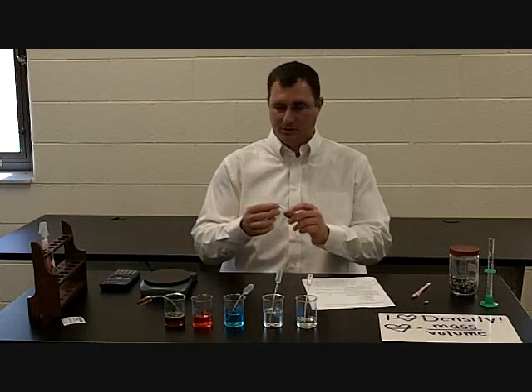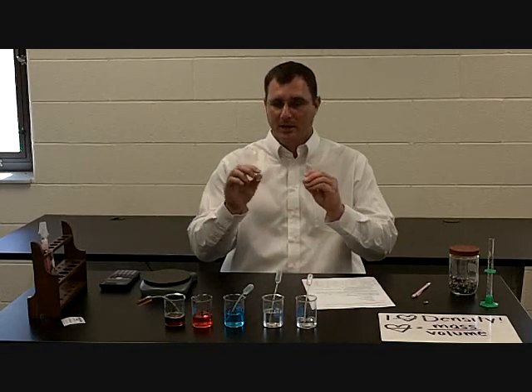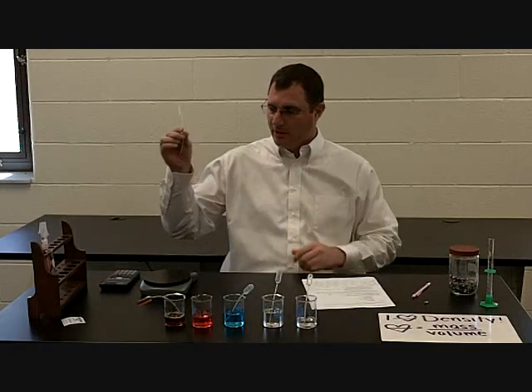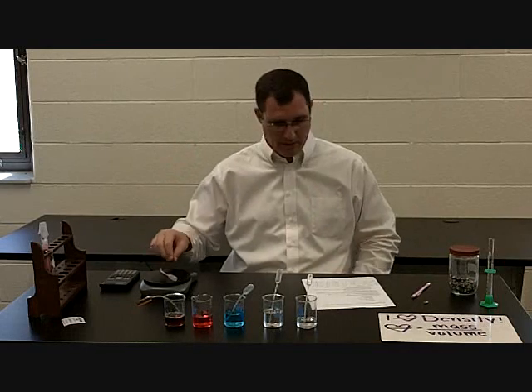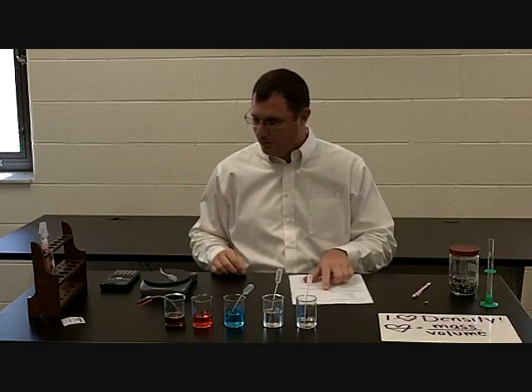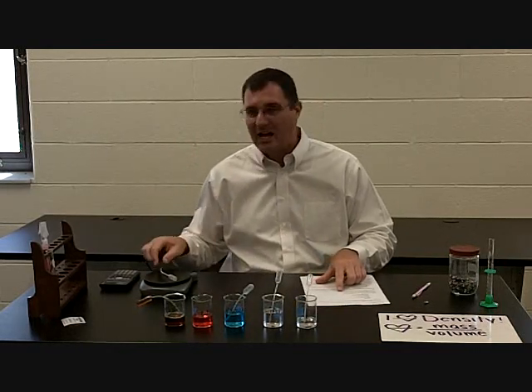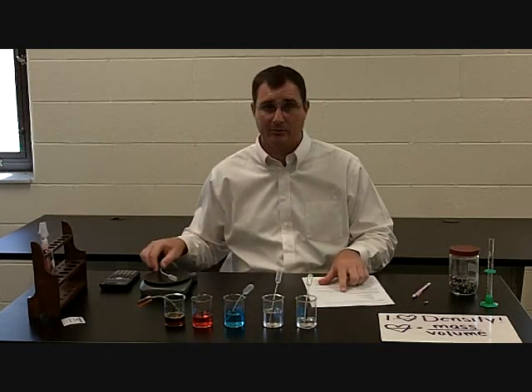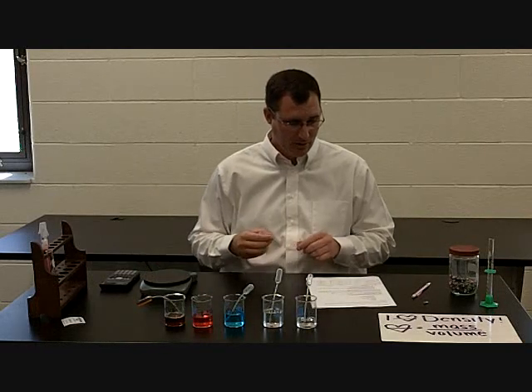The first thing you're going to do is you're going to take a pipette and you're going to go ahead and find the mass of a pipette. The pipette weighs 0.9 grams. You're going to put that on your sheet.